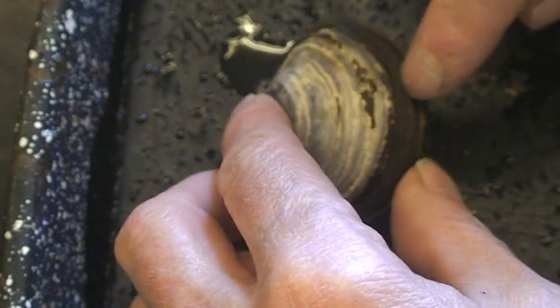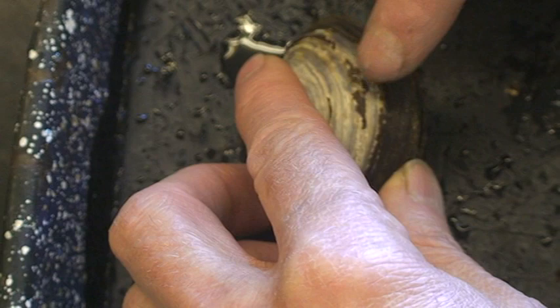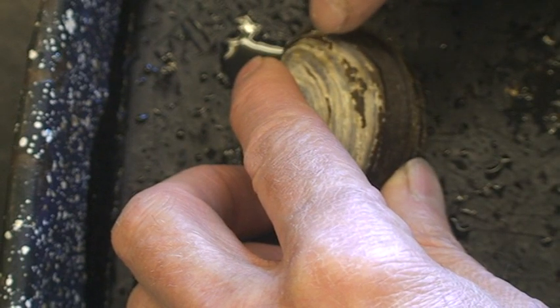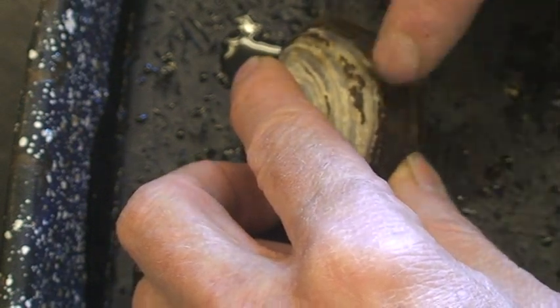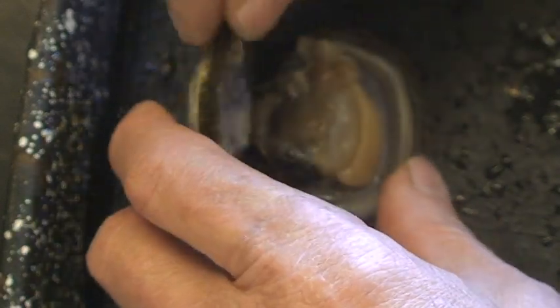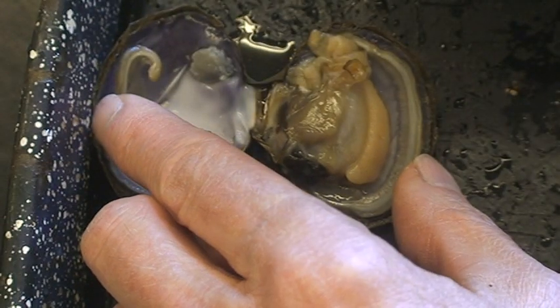You can see they're kind of purple on the outside, and this material here is called the periostracum. It's a protein that is part of the shell. In some species there's not much protein when the shell is fully formed, but in this one there's quite a bit of periostracum left, so it's oftentimes a lot shinier than we see in these. If you open it up, you can see on the inside also there's purple on the inside of the shell.